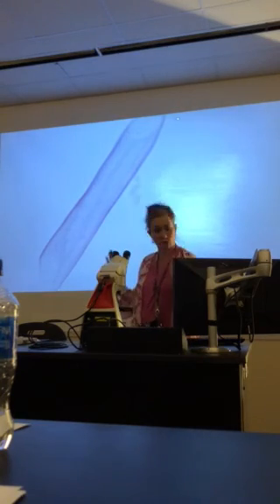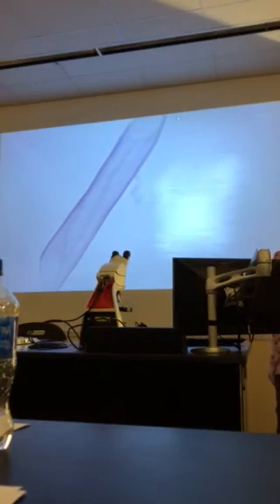The xylem is difficult, okay? Tracheids with pits are going to be really long and narrow with very large openings and holes. They're going to look like little flutes. Vessel elements are just going to be very wide. They're going to tend to have a bit more of a cross-hatching appearance to it, okay?